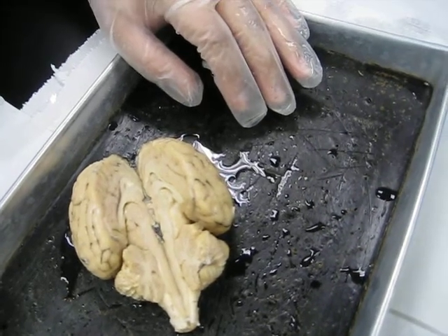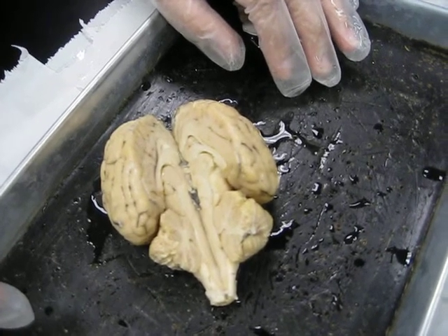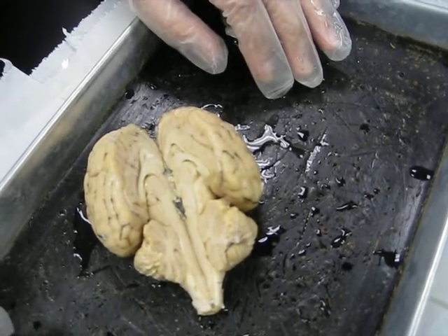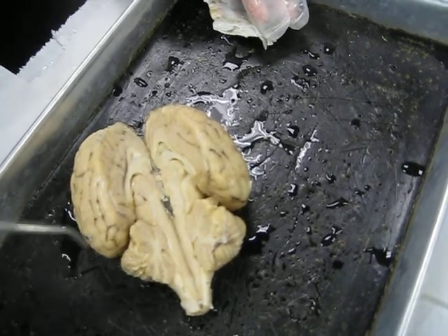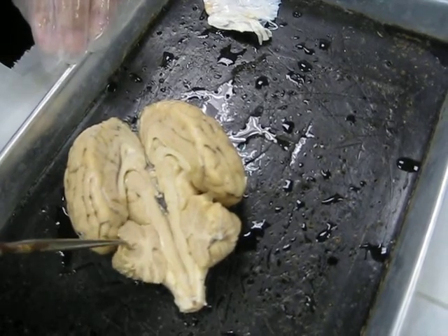So we're looking at an inferior view right now. I'll turn it back over to the superior view. It'll fall in half like this when you've made your cut. Okay, looking at the halves here, we can see that on the inside of the cerebellum, here's the cerebellum in the sagittal section, we can see that there are two kinds of material in the cerebellum. There's this darker outer gray matter, and then there's a branch pattern of white matter.